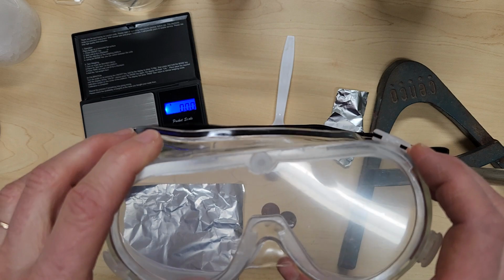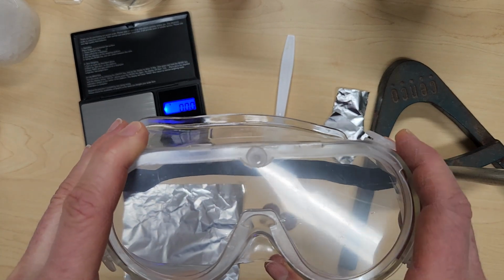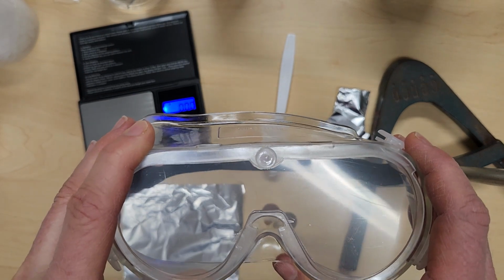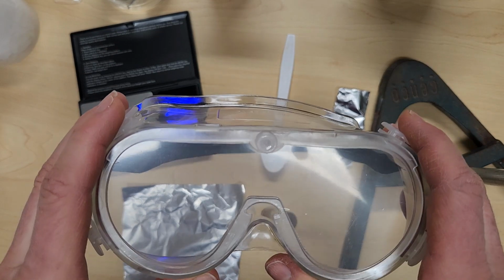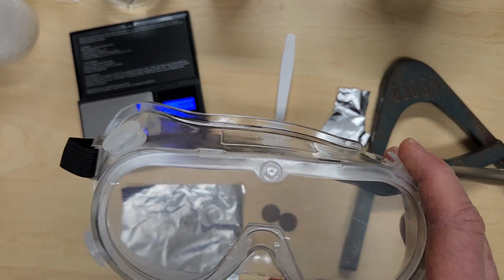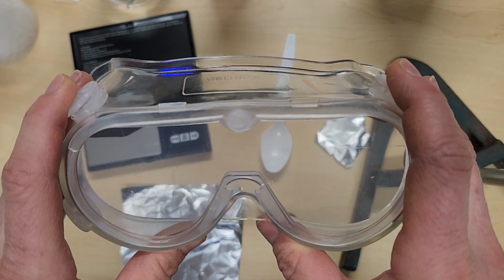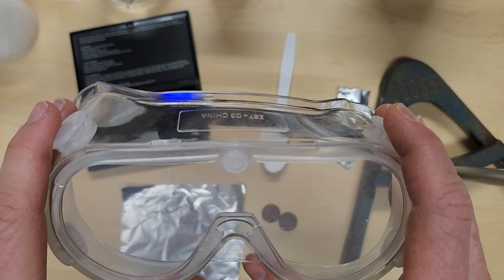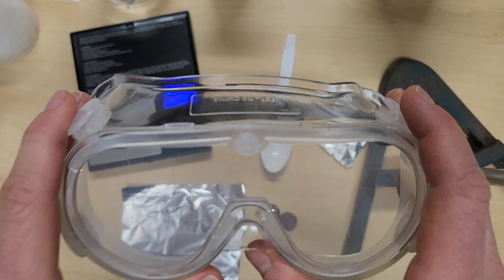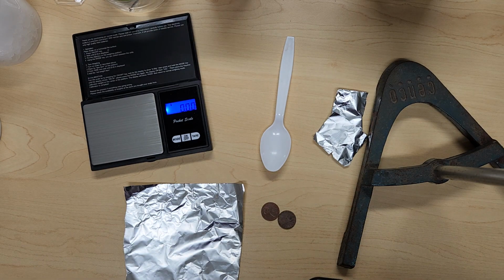As always, it's essential that we put safety first, and one of the best ways that we can do that is by wearing our safety glasses. And so I'm going to ask you to take a selfie wearing your safety glasses, or put a note card with your name showing those safety glasses if you don't want to do a selfie, and include that in your report form. So I'm going to put my goggles on right now so we can get started explaining the procedure for this lab.